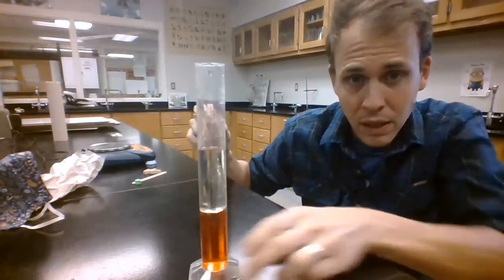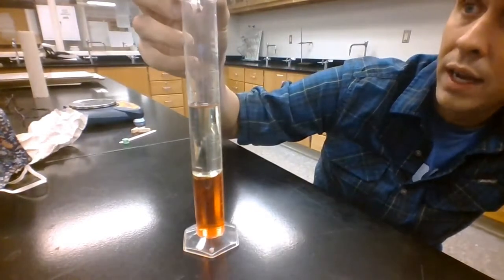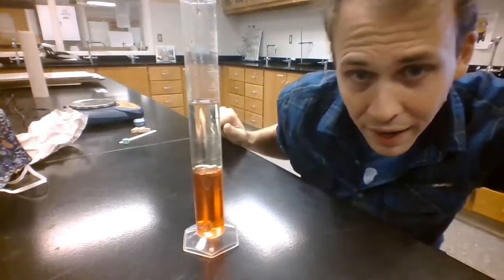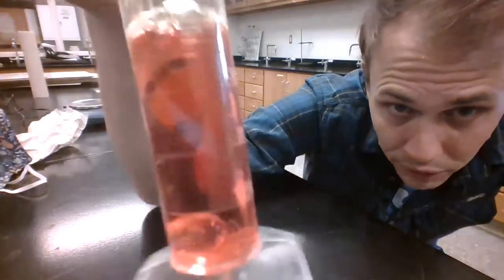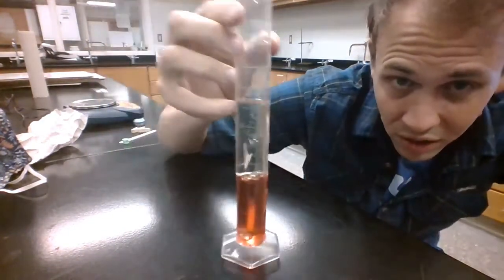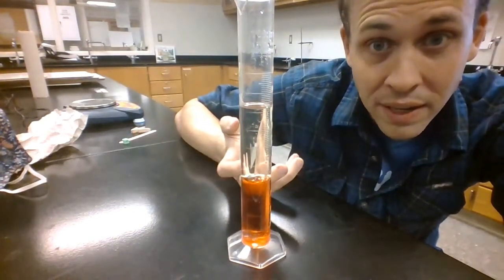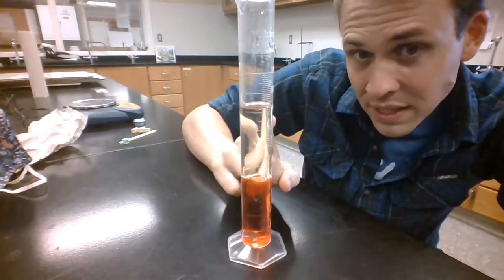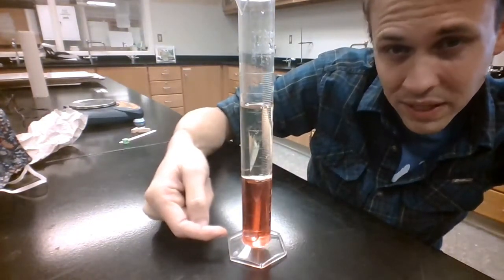I'm going to move this up a little closer so you can see the whole thing. I've got my solid going into two liquids here — and Geronimo! I don't know if you can see it, but there's some liquid getting displaced from the bottom, and our big bruiser is resting at the bottom of the column. That tells me something about the density here. Now I've got three things I can compare: I can say something about the density of the red liquid, the yellow liquid, and now the marble.